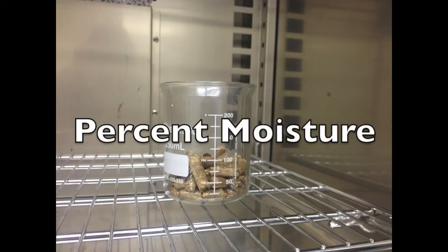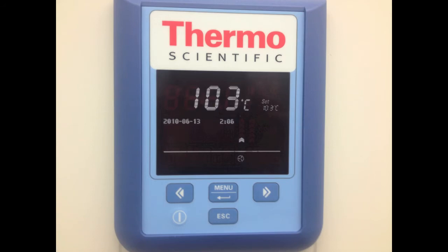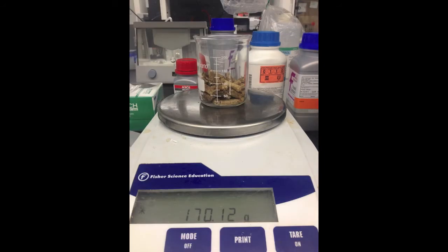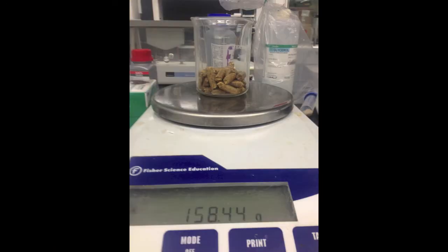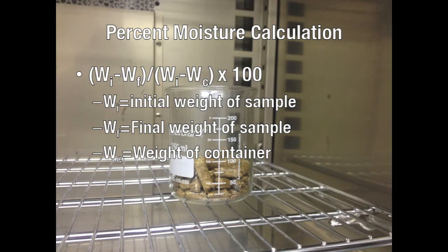Next, you will measure moisture content. First, obtain a glass, metal, or ceramic container capable of holding at least 50 grams of your sample. Set the temperature of the drying oven to 103 degrees and place the container in the oven for 30 minutes. After 30 minutes, cool the container in a desiccator. After it cools, find and record its weight. Next, add at least 50 grams of material to the container and record its initial weight. Place the container and sample in the drying oven for 16 hours at 103 degrees. Remove the sample and allow it to cool to room temperature in a desiccator. After it has cooled, immediately record its final weight. To calculate percent moisture, divide the initial weight minus the final weight by the initial weight minus the weight of the container, and multiply by 100.